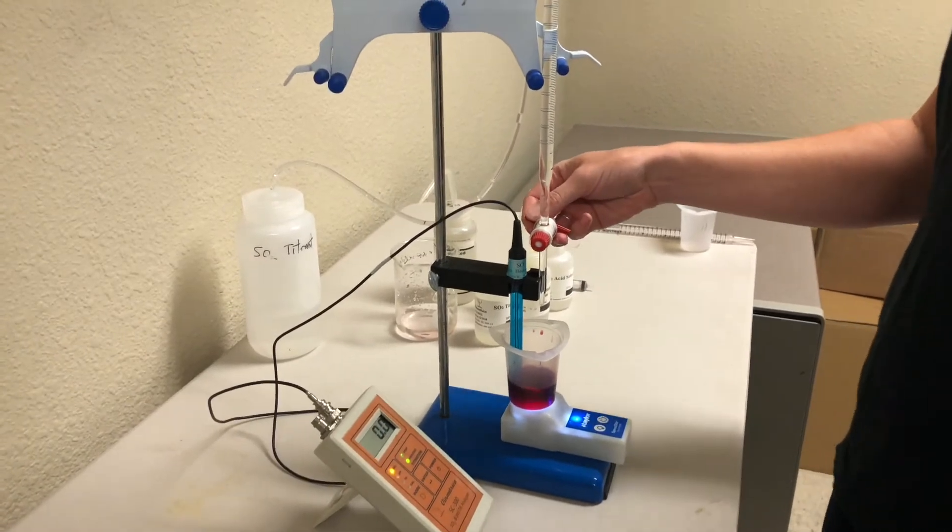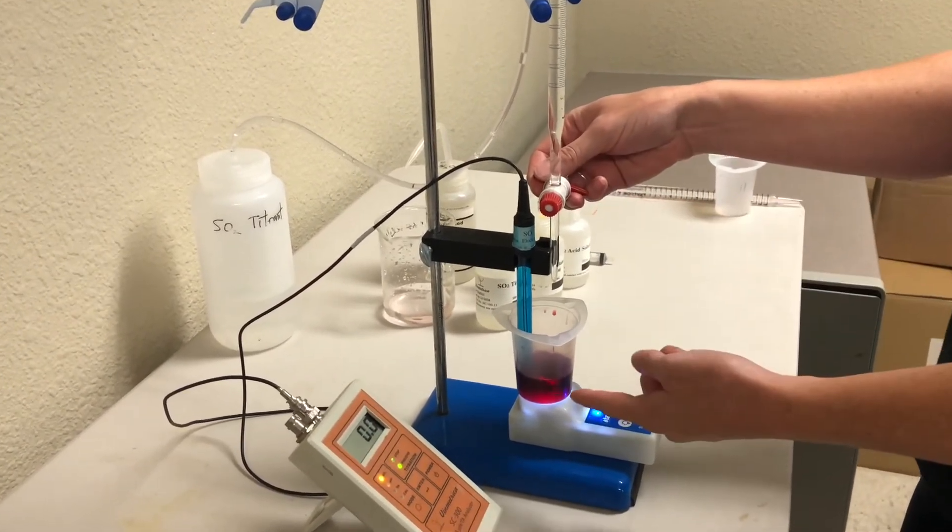Now, drop by drop, I will add SO2 titrant into my wine sample.